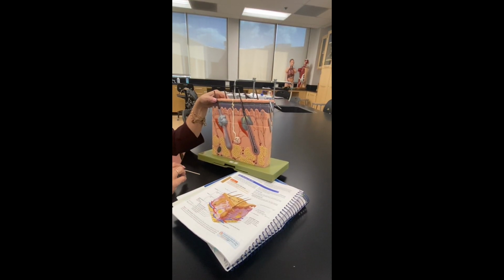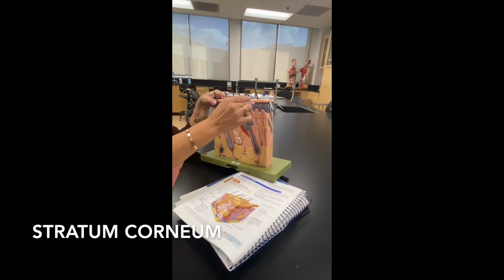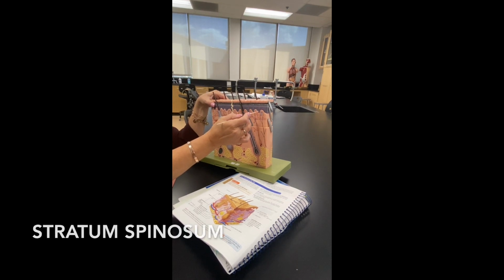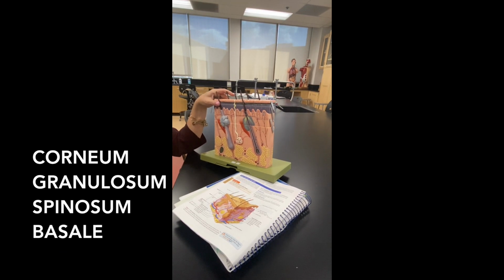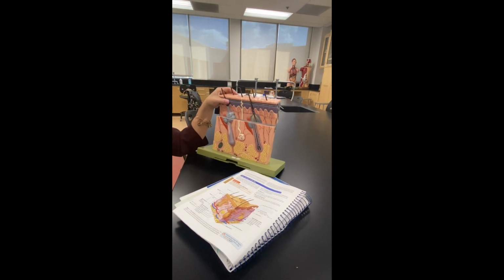If we look at the epidermis, you can see the layers. Stratum corneum, stratum granulosum, stratum spinosum, and stratum basale. Now here I should have thick skin. No, I have thin skin, that's fine. This one's fine. The other one shows you the difference between thick and thin, having the stratum lucidum. So let me get the other one.